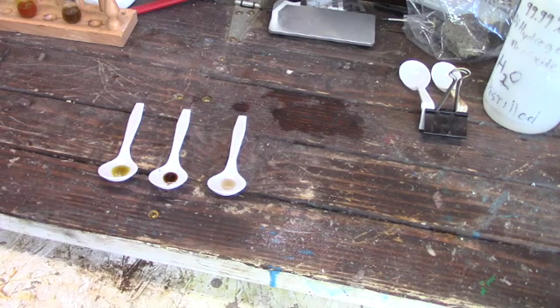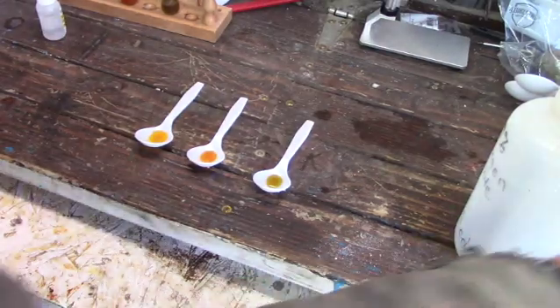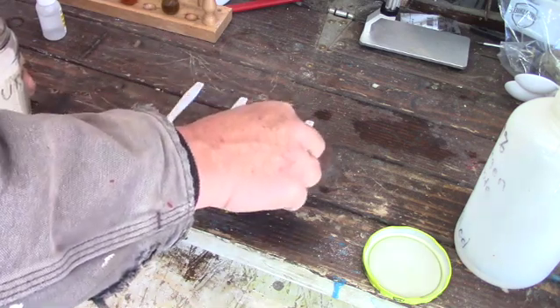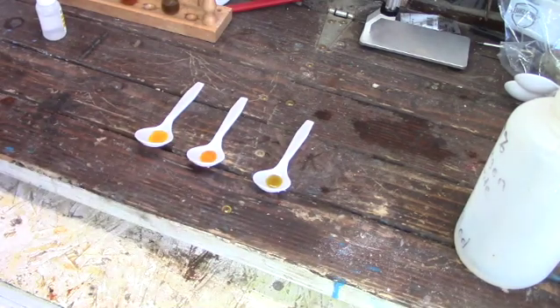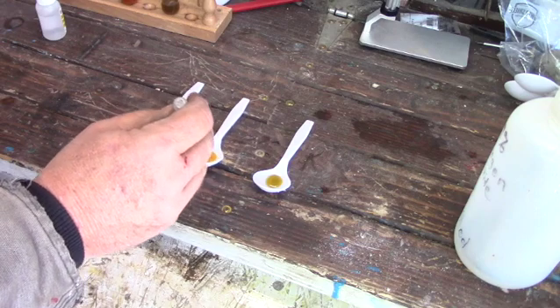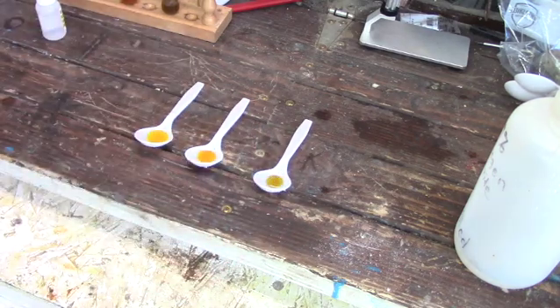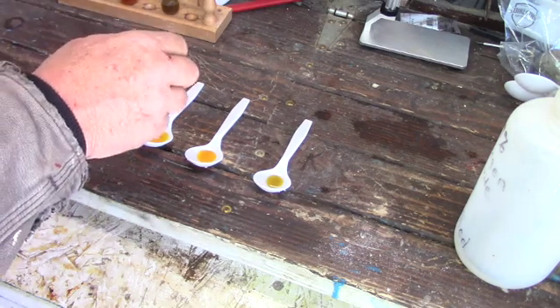I didn't realize it at the time, but I haven't been de-noxing these tests. So we're going to go back and do the test again, and we're going to de-nox each of the spoons. We're going to be using urea — put a few grains of urea into each one, then give it a little stir using a pipette to get the urea dissolved in it, and then apply our stannous chloride and see what our results are. Between stirring each sample, I'm washing off the pipette to make sure I don't cross-contaminate. We'll let these sit a little bit to let the urea kill off the nitric acid, and then put our stannous chloride solution in.